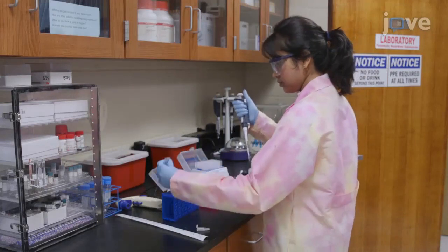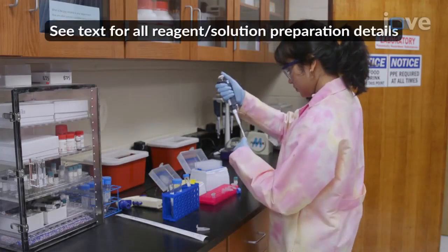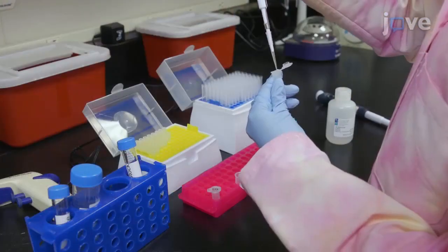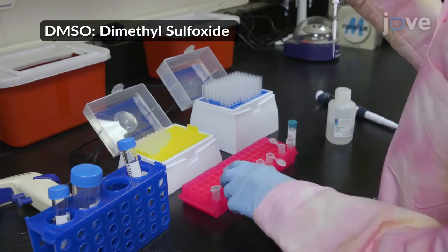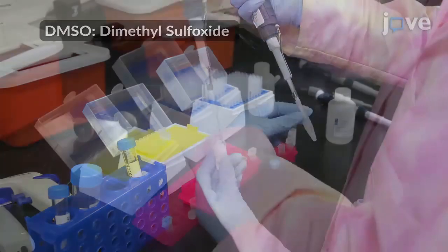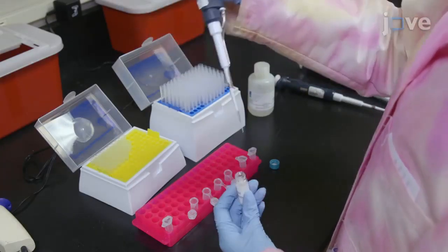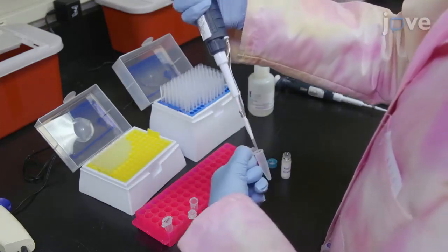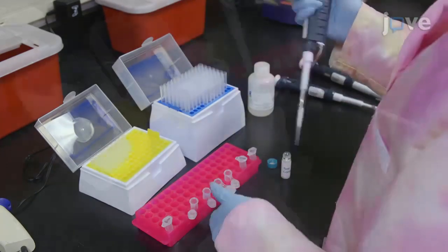To prepare the substrate and test compounds, add 12 microliters of substrate to each of four 1.5 milliliter microfuge tubes, and add 6 microliters of deuterated DMSO to the 0-minute control and 30-minute control tubes. Add 6 microliters of the test compound to the first experimental tube and 3 microliters of the test compound and 3 microliters of deuterated DMSO to the second experimental tube.